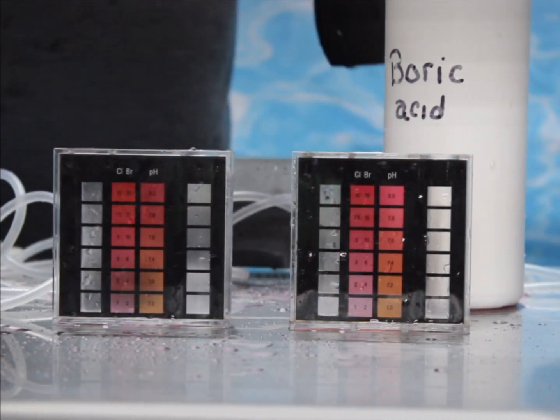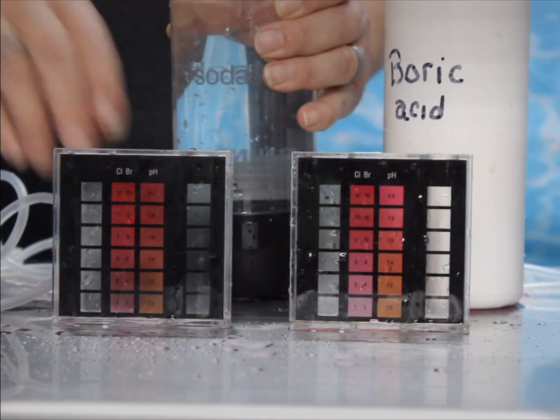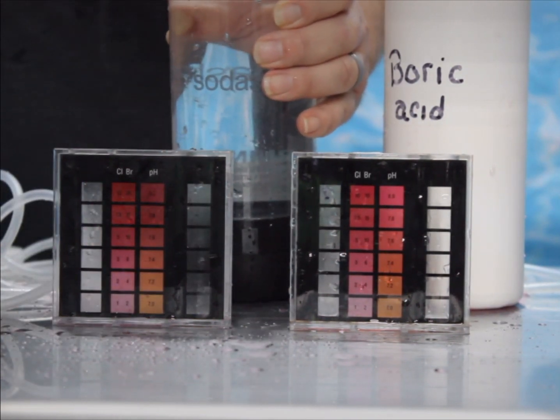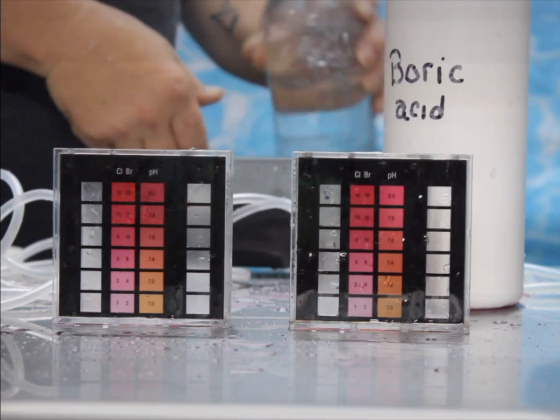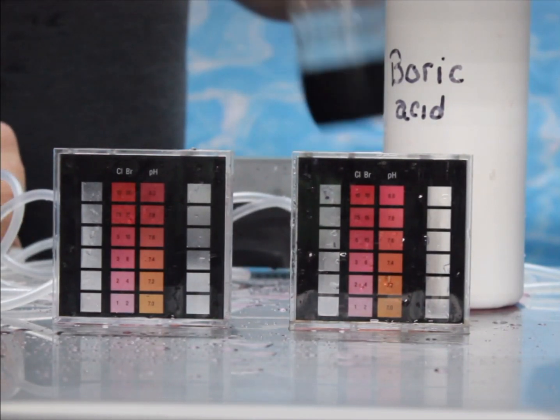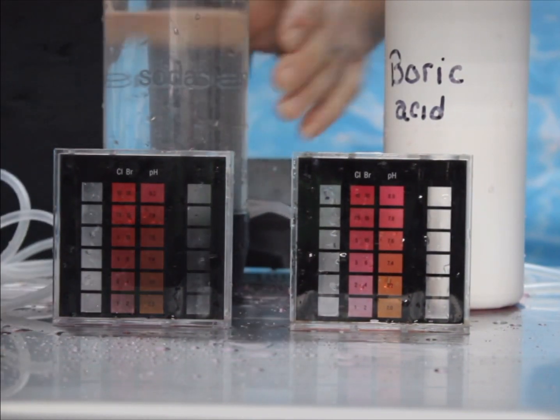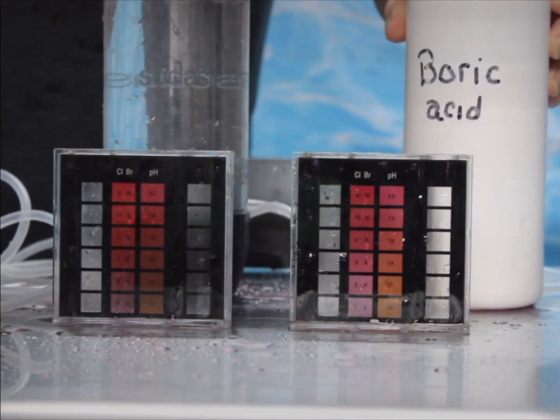That's enough to give me 50 parts per million — not a lot, there are really small measures in this. I'm going to shake that up a little bit, just invert it a few times so I can get my boric acid nicely dissolved throughout the entirety of my sample.